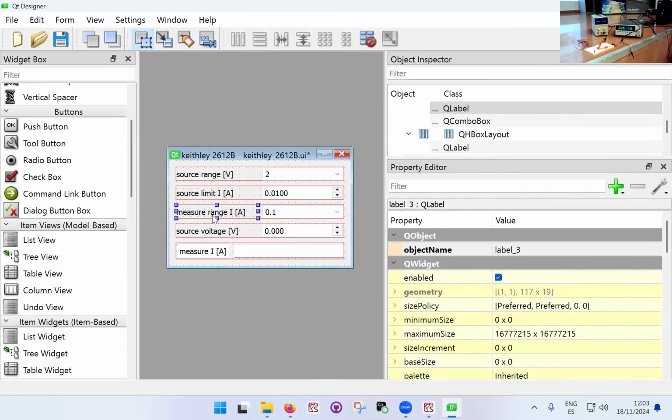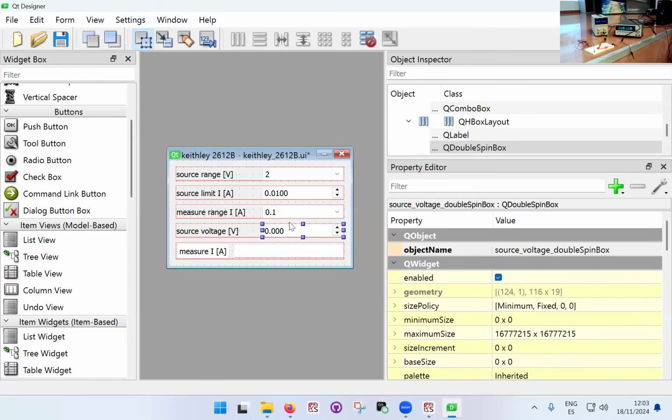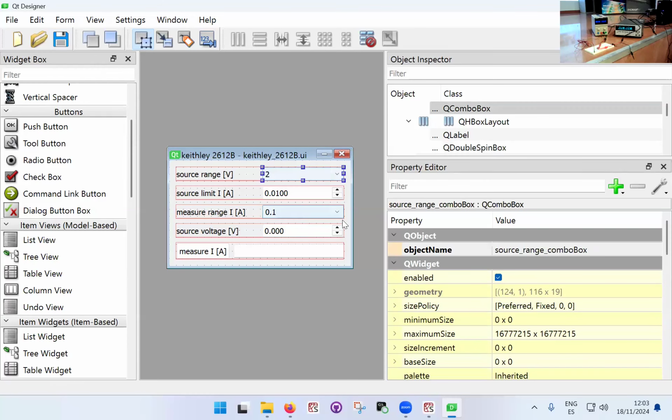These are all the labels. These don't really have a function, really. I could interact with these as well if I really wanted in Python, but because these are just labels, they're sort of things for the user to see what they're doing. They have a name as well, but I'm not interested in this name, so I'm just going to leave it default as it is, label 1, 2, 3, whatever. Okay, so we've got these functions.